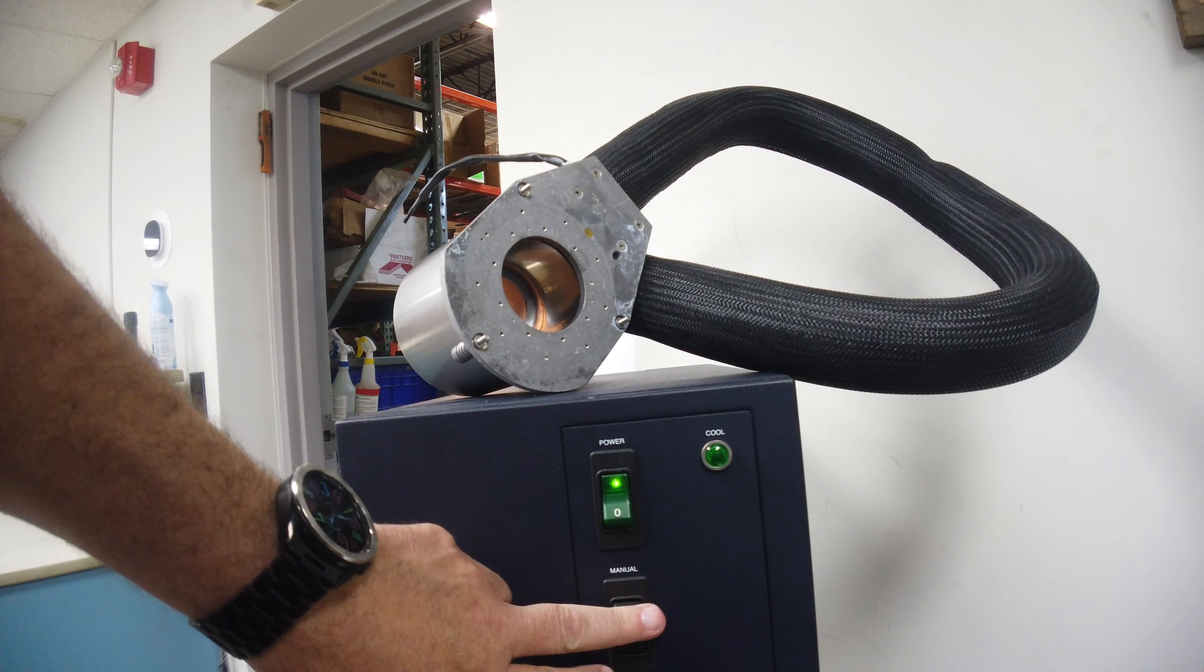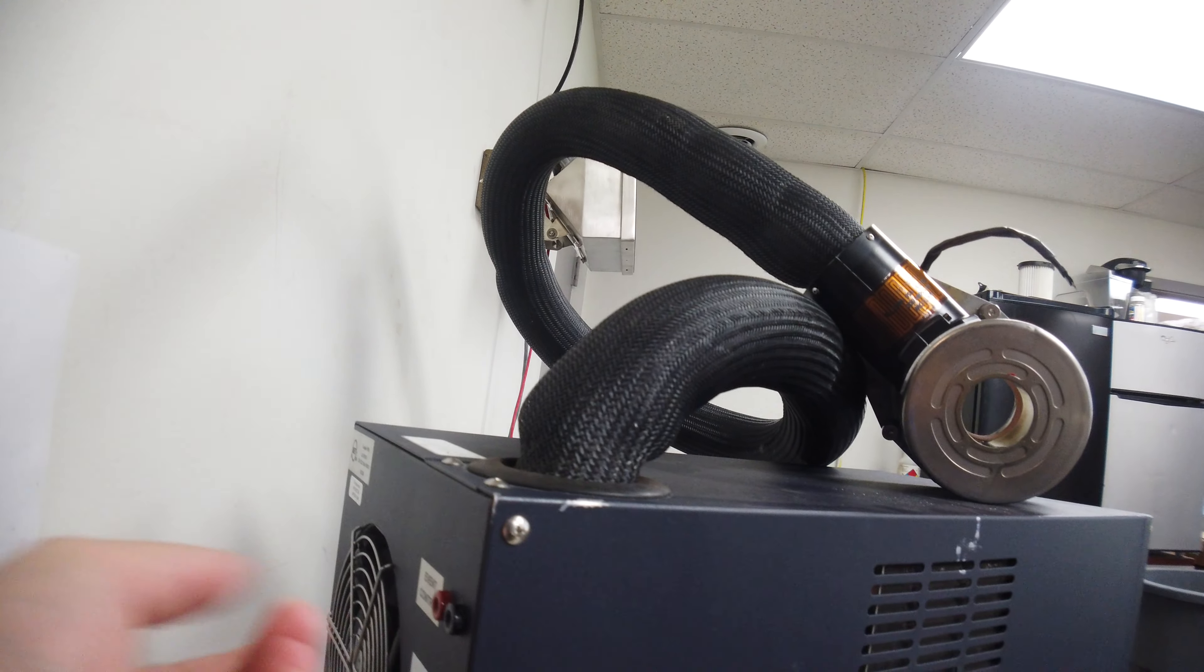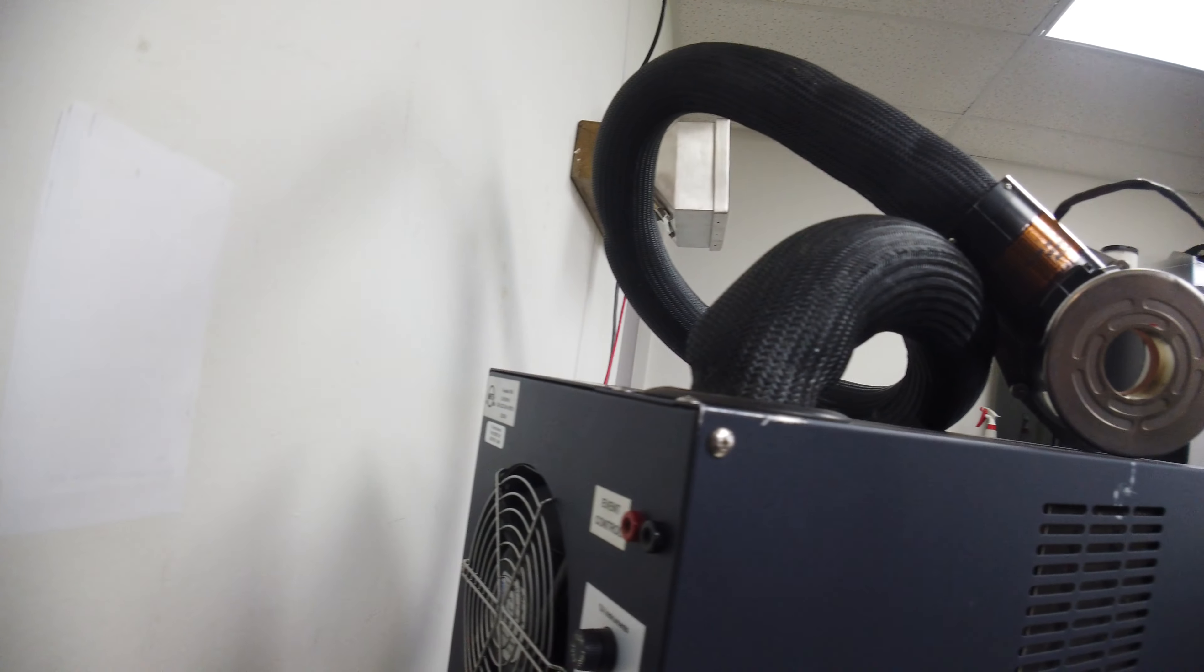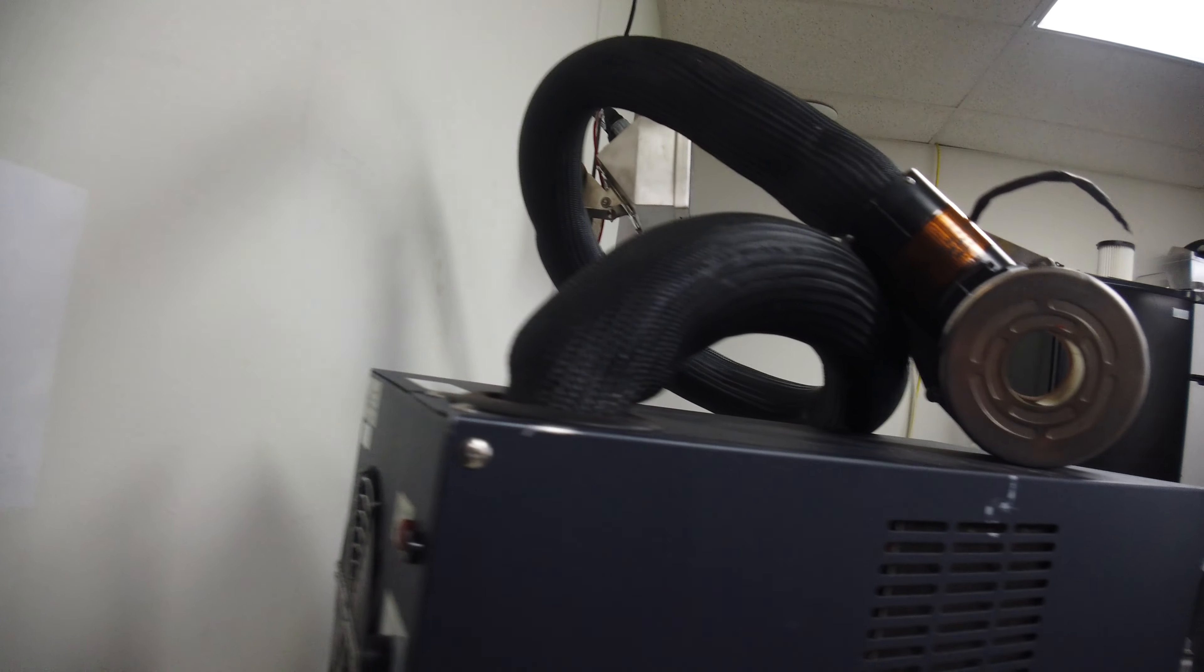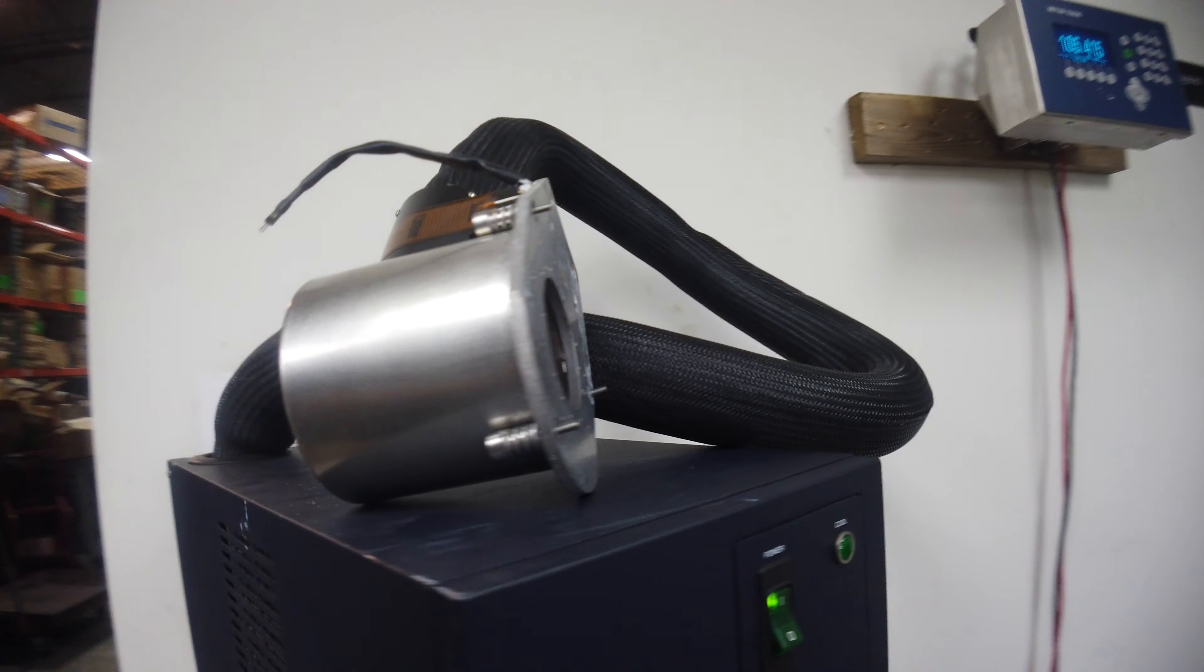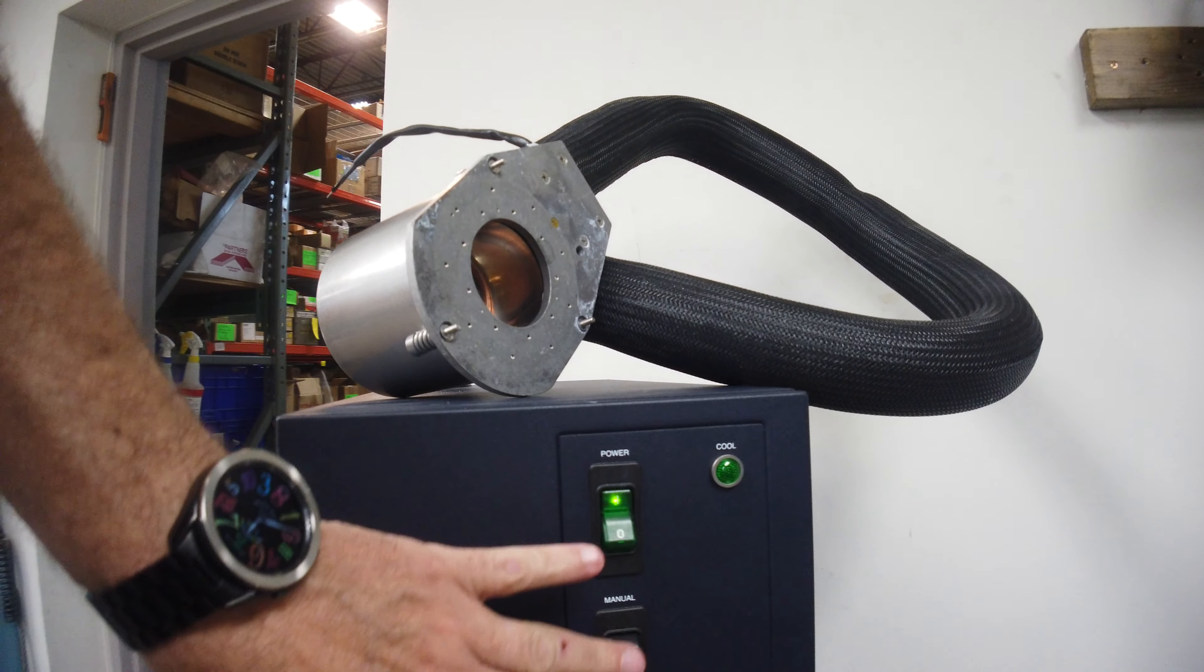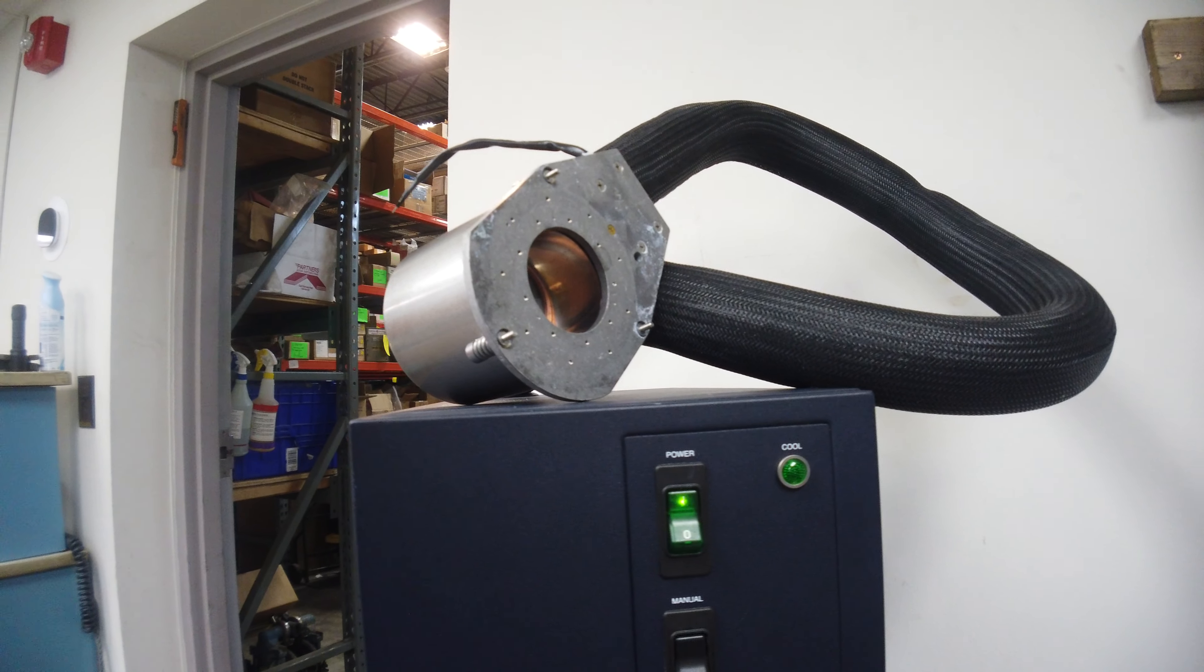It's on a vent right now. Which I imagine if you had an input here for vent control, it just looks like it's a red and a black, so it's probably just power. So you could have it set up that way, maybe on a timer. But we'll throw it on manual.